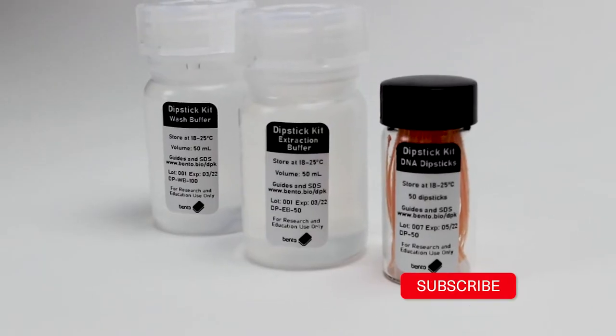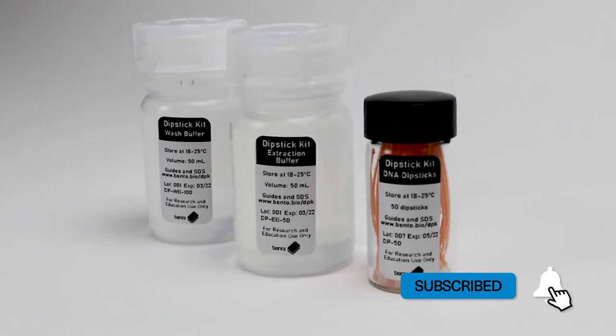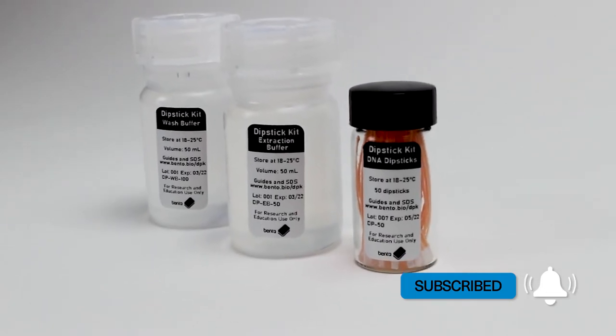For this tutorial, I'm using the Bento dipstick DNA extraction kit. The kit comes as a set of bottled DNA dipsticks and two solutions, an extraction buffer and a wash buffer. Let's get started.